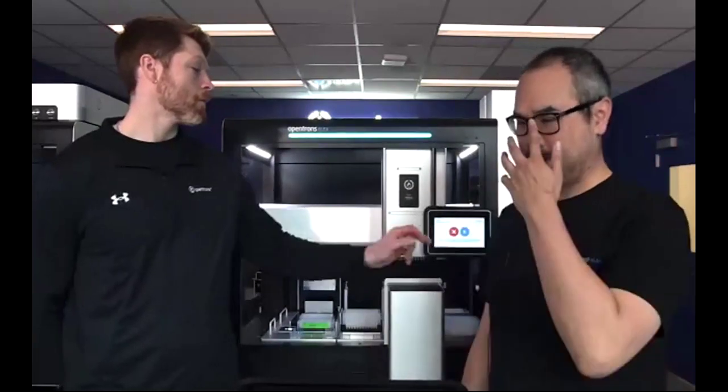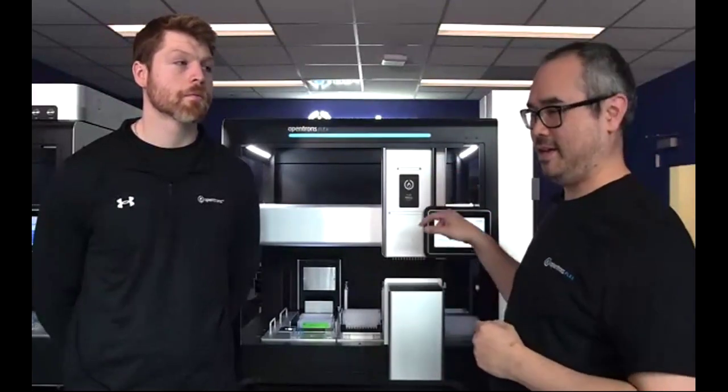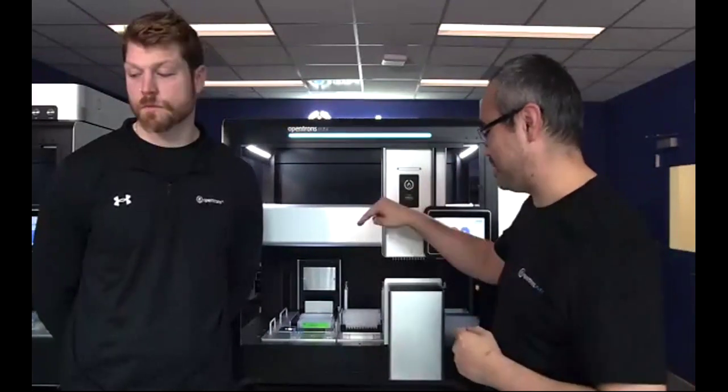Yeah, it is totally possible to have more than one temperature module. I believe the current suggestion is it's only on the left-hand side of the robot, so only in column 1. Right now in this setup, half of column 1 is taken up by the thermocycler, but positions C1 and D1 could both take temp modules.